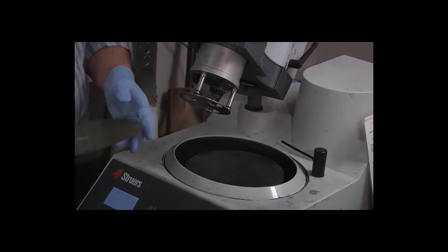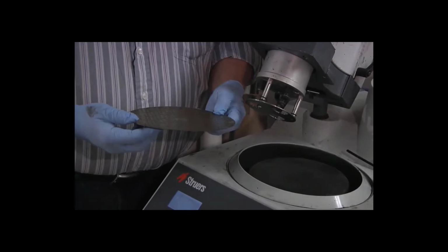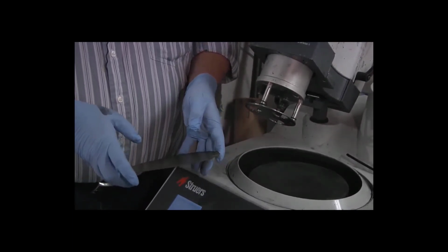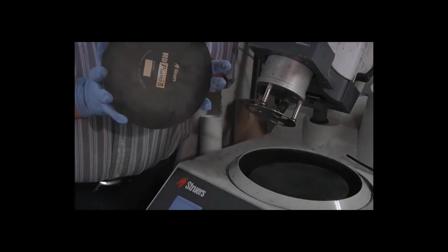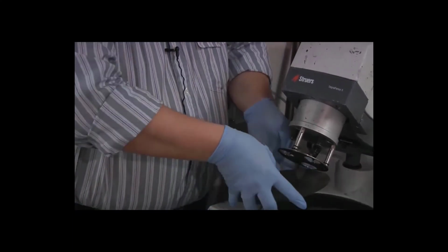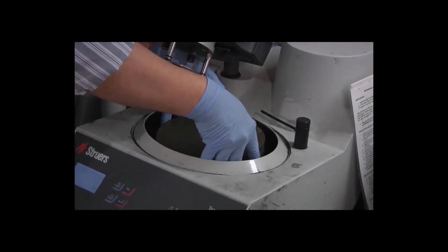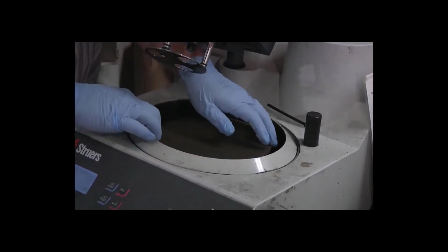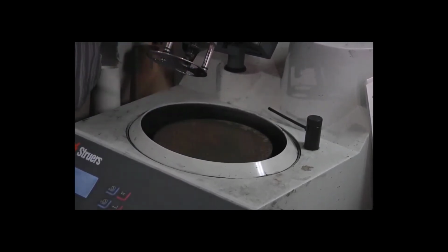The turntable's magnetic. The back of the disc is steel, but the back has a very rough surface. So we need to get it centered on the turntable as well as possible, because once it's attached, it will not slide. The best way to do that is to space your fingers around the perimeter of the disc and use those as a guide to lower the disc straight onto the turntable. So I get my fingers all in contact with the turntable, slowly lower them, and the disc snaps into place, and I don't have an overhang of more than 1 millimeter on any side.